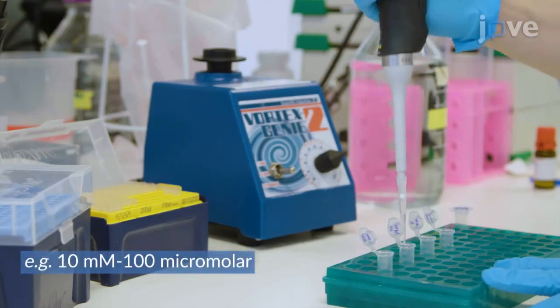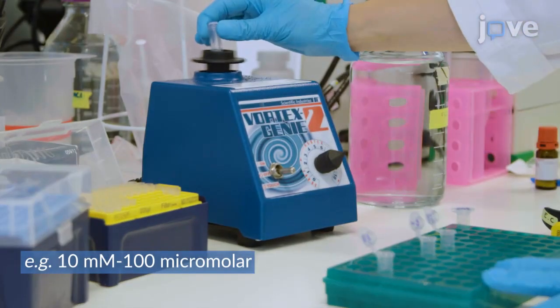Then, dilute the filtered chemoattractant stock solution in series according to the experimental protocol.